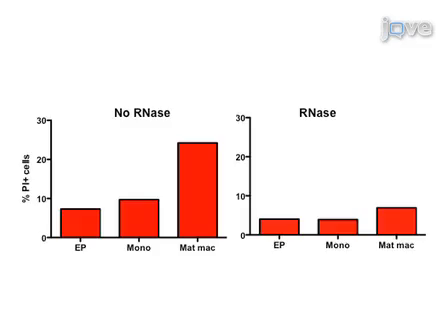Cells stained by the modified protocol exhibited a visual reduction in the number of positive PI events due to removal of false positive events by the RNase treatment. Further, this effect was more pronounced in large mature macrophage cells than in smaller early progenitor cells. Conclusions based on conventional protocols would have erroneously suggested a positive correlation in cellular death for the more mature macrophage subsets.